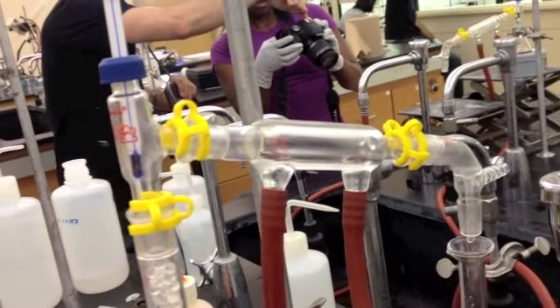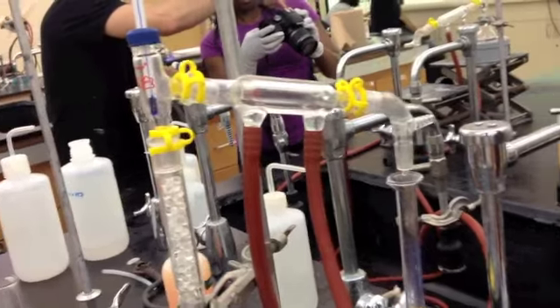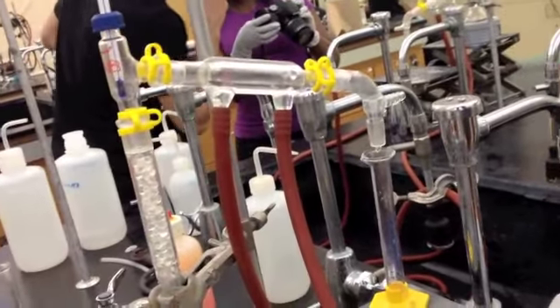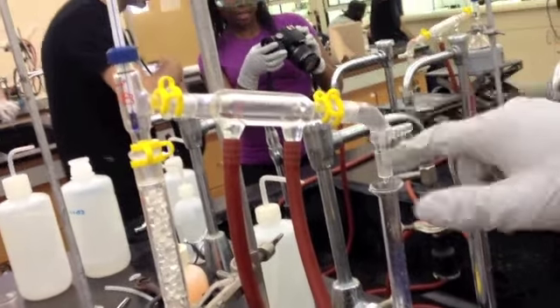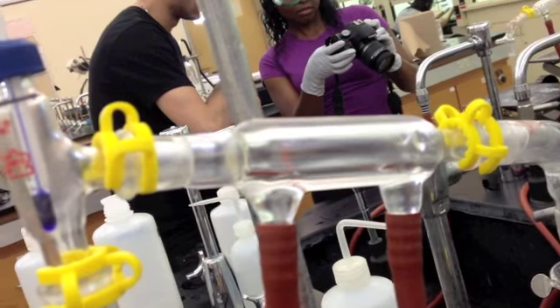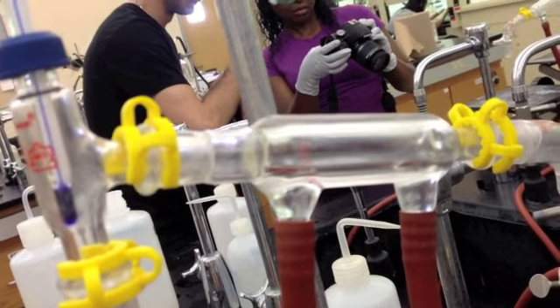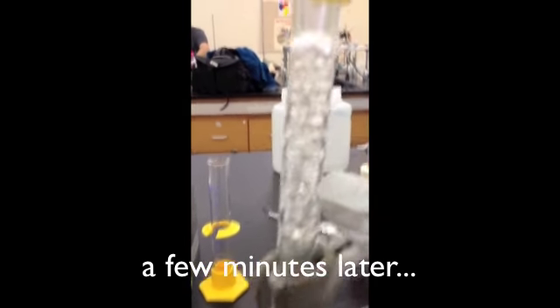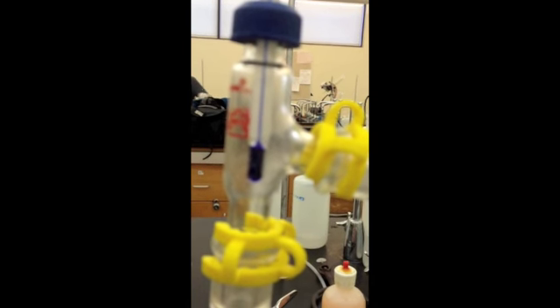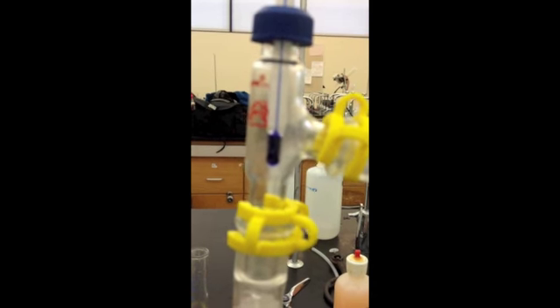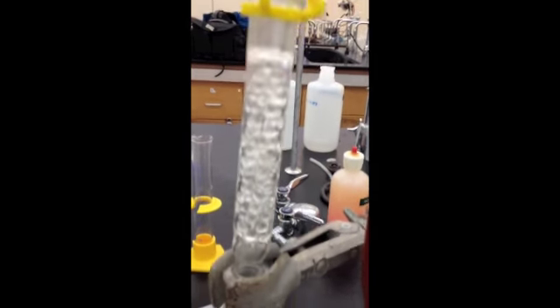This is too little water. You want water to be uniform throughout the water jacketed condenser. And you can see vapors moving up your air column and reflux on the air column. On the thermometer, you should see a reflux ring when it's about time for the distillation to occur. Right now we don't see it because it's still taking its sweet time.